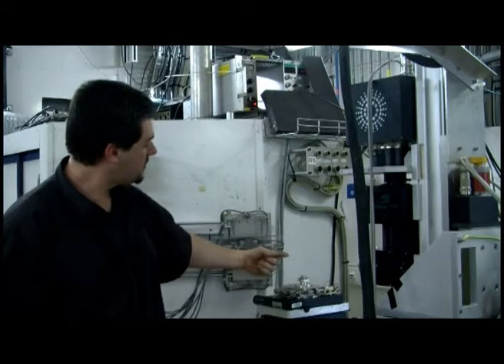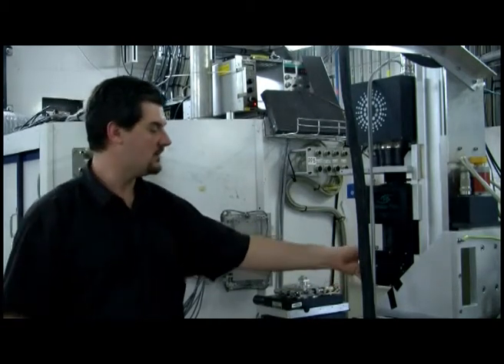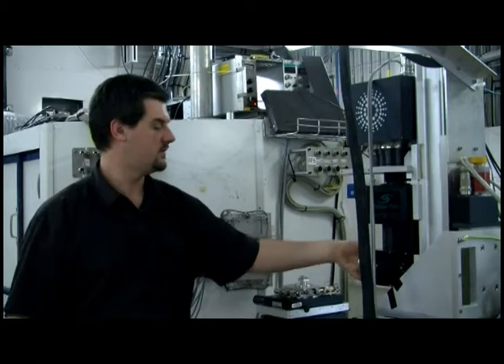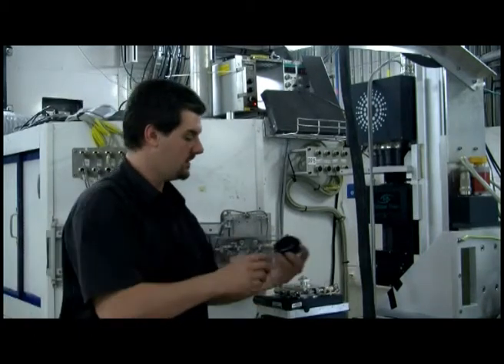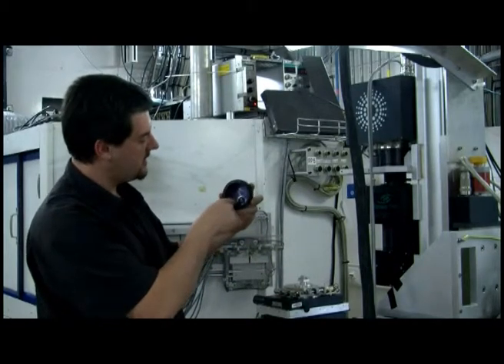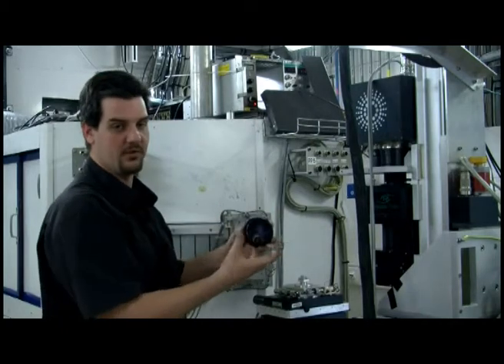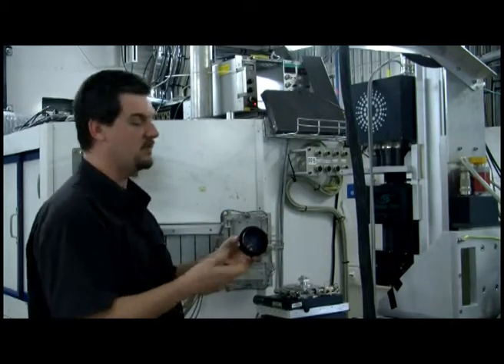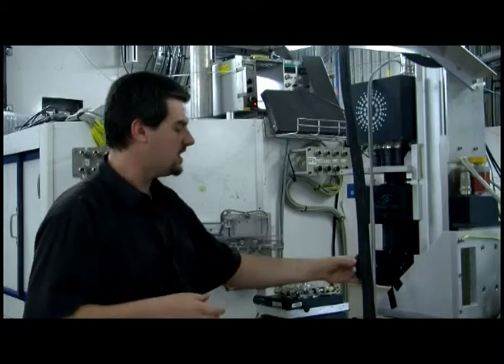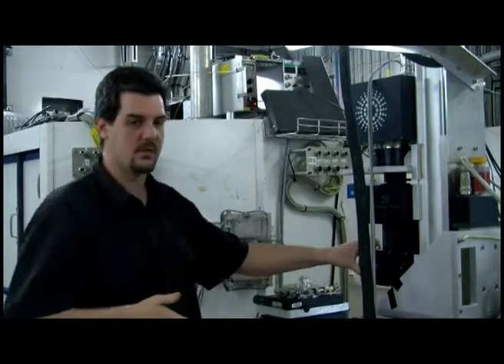So the X-rays go through the sample, and after they go in the detector. The detector is just a microscope, so for high resolution in such case. And inside that cup, you have a small device that is called a scintillator, and it is the real important part for the detector. It is converting X-rays into visible light. And so at the end, what we are seeing is visible light. We are not directly seeing the X-rays.